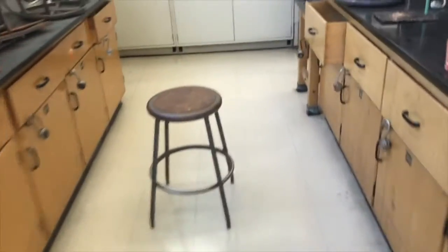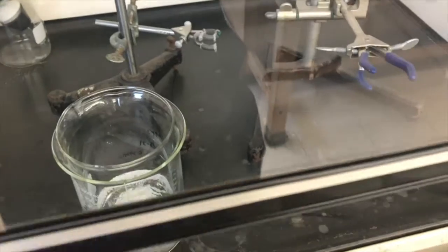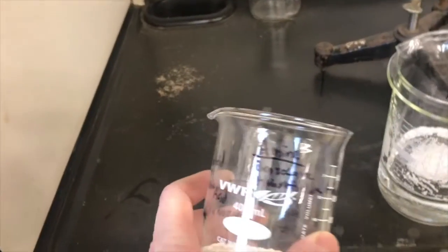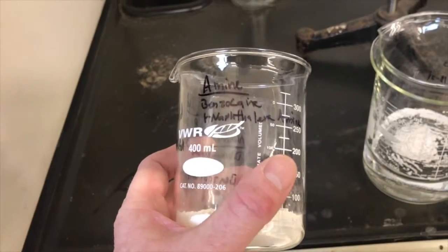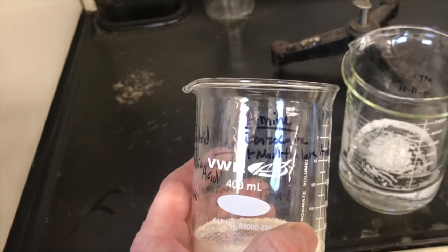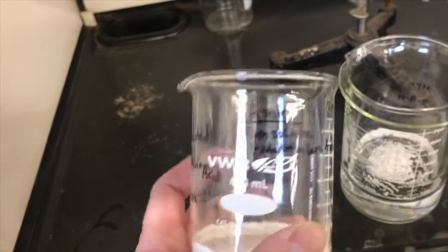Lab. Let's go find that organic layer solids. What is it made up of? A neutral compound and dibromobenzene. So I've got a couple things going here. What's this one? This is either, yeah, this is it, an amine with benzocaine 1-naphthalene amine.